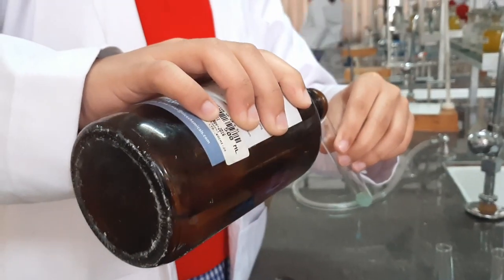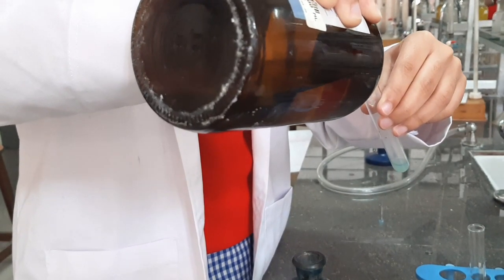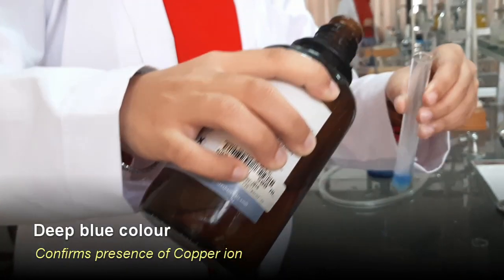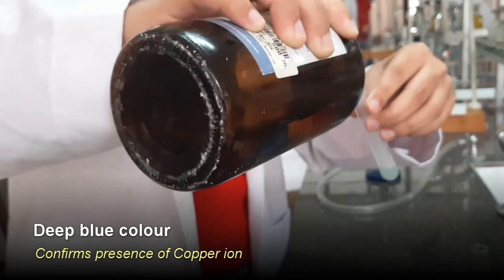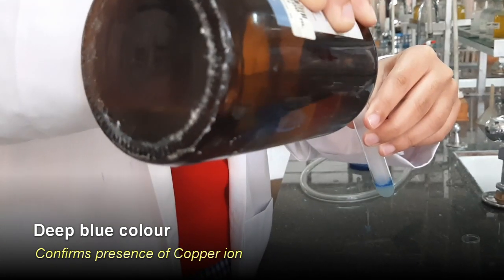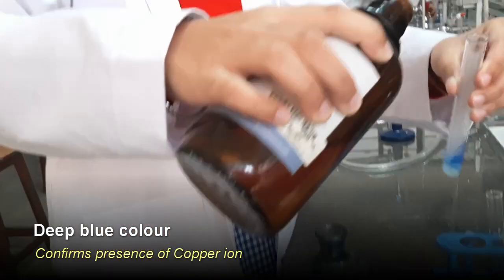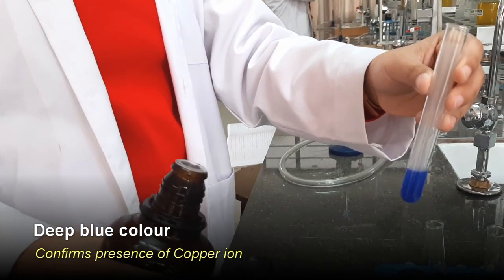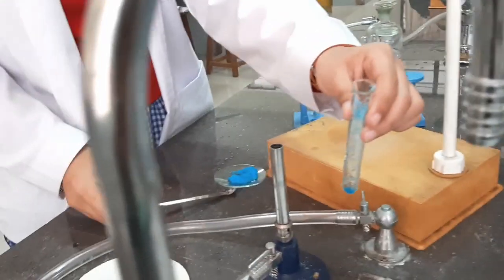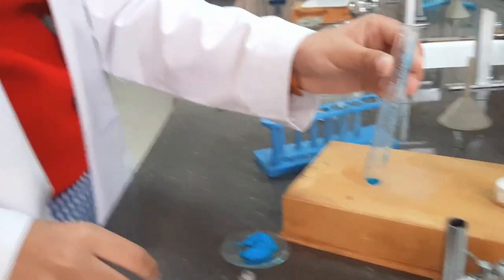We are adding ammonium hydroxide. Deep blue color confirms presence of copper ion. This deep blue color confirms presence of copper ion. Proceed for anion analysis, that is the acid radical analysis.